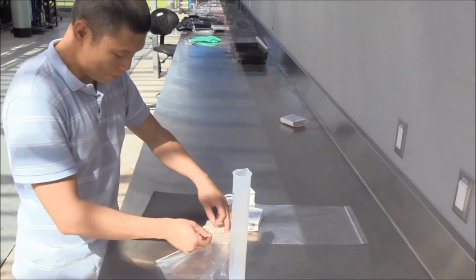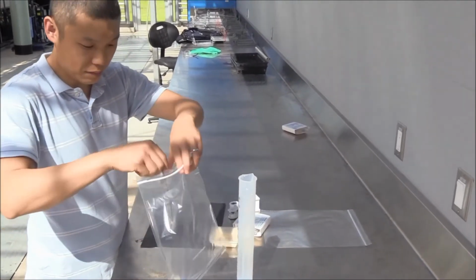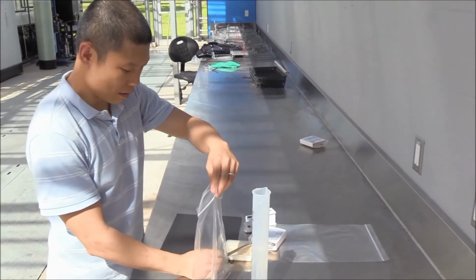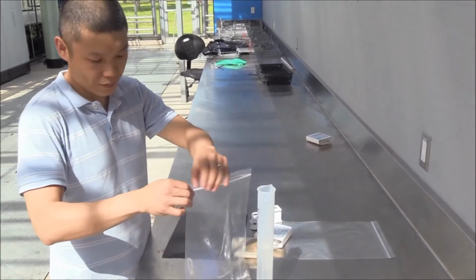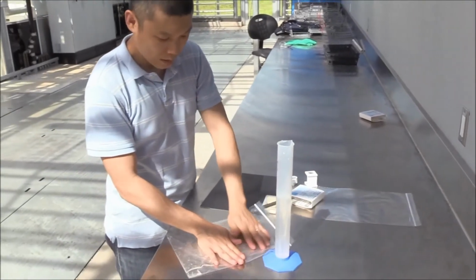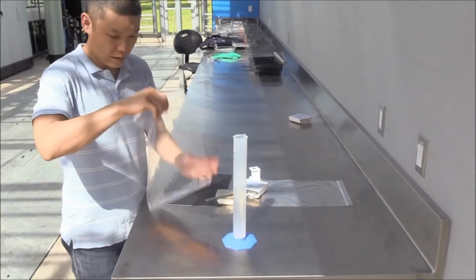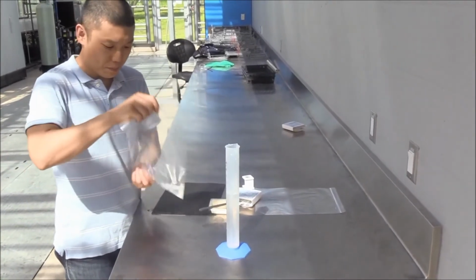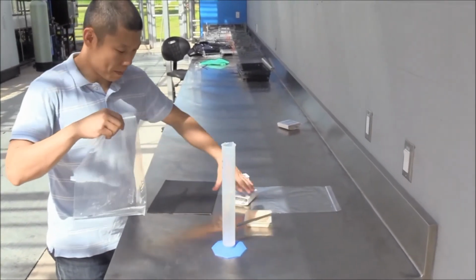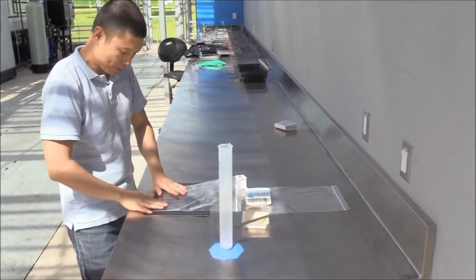Place a small amount of the product in a Ziploc bag with about 5 milliliters of water at room temperature. Mix to create a suspension and leave for a few minutes to allow the nematodes to rehydrate. Alternatively, take a 5 ml sample from the spray tank, nozzle or irrigation system. After waiting for a few minutes, check to see if the nematodes are actively moving or swimming.